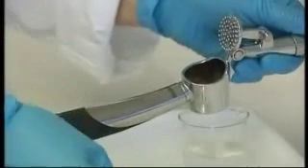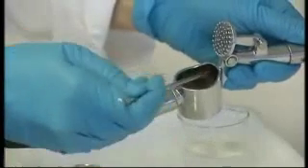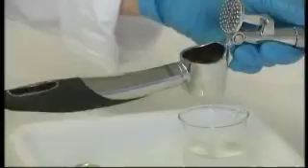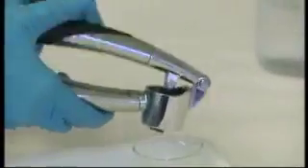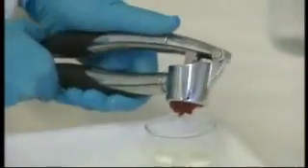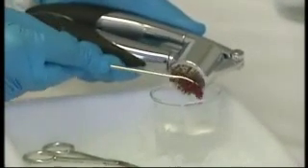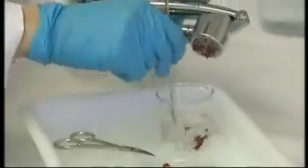Put the minced tissue into the tissue press and pass it through. After the tissue press, transfer the material into the beaker with 50 ml of washing buffer and stir.